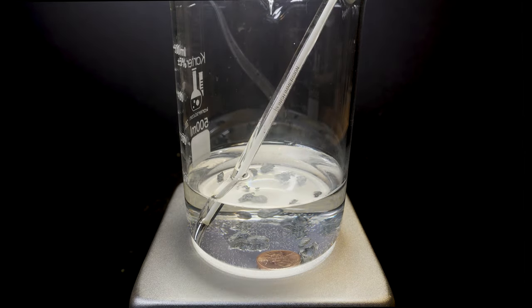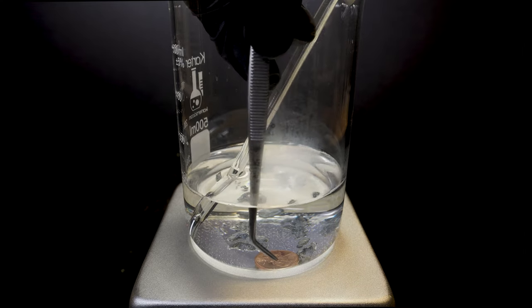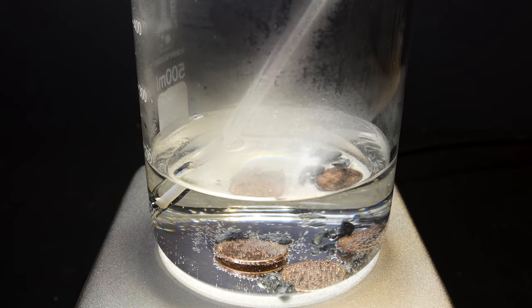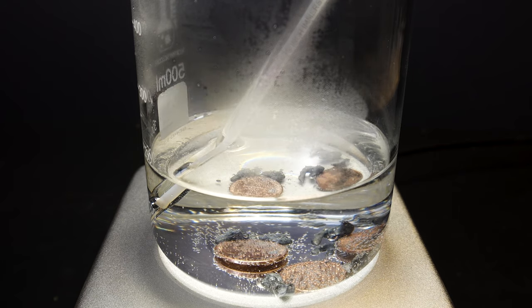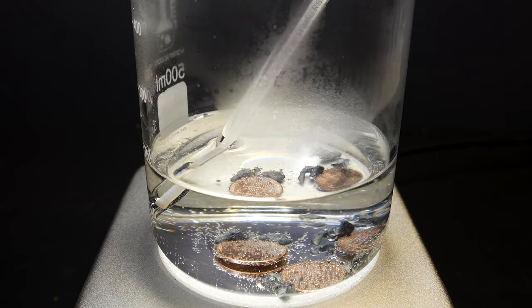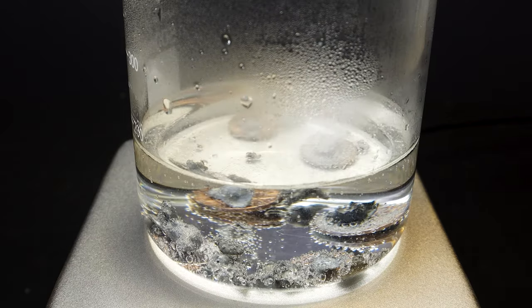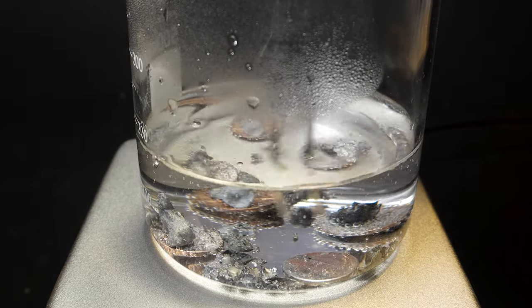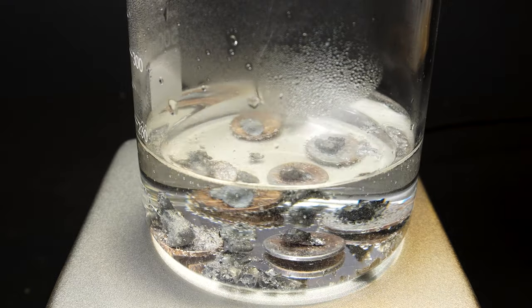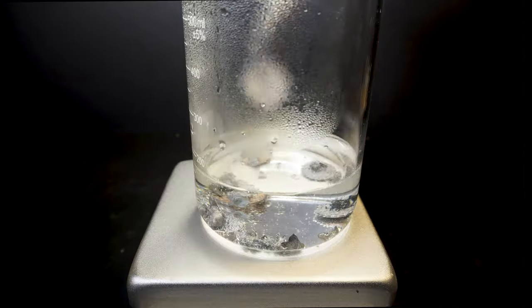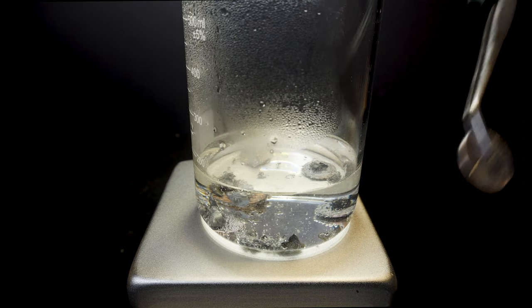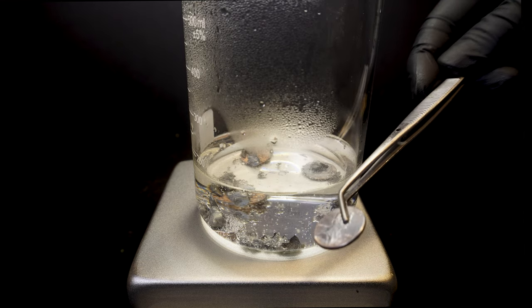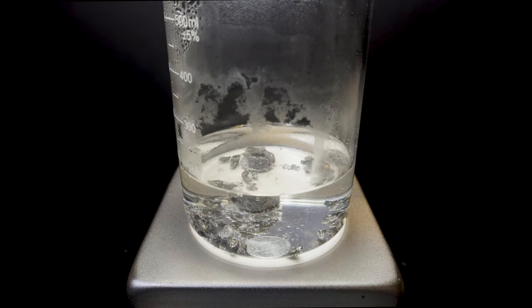The trick here is to have all the pennies touching the zinc pieces but not have the pennies touching each other. Over the next 10 minutes each penny will gain a zinc coating which we can see when the penny starts turning silver. After a while it is highly recommended to flip each coin over to make sure both sides are being coated. When we take the coin out of solution we can see that it still has some areas to be coated and it turns out the less you move these pennies the better. But I was really impatient so I ended up moving them a lot.